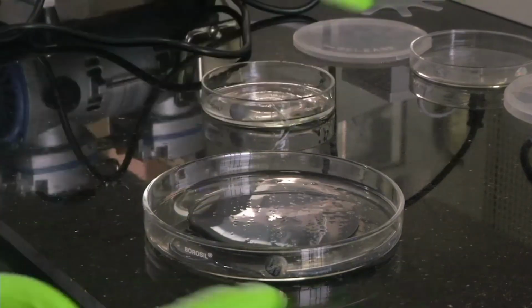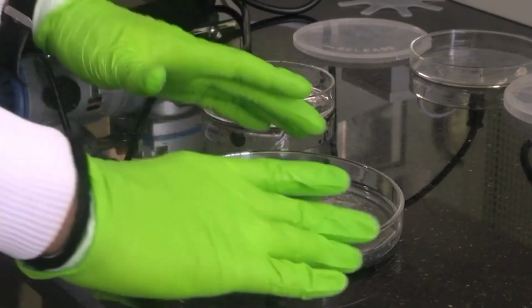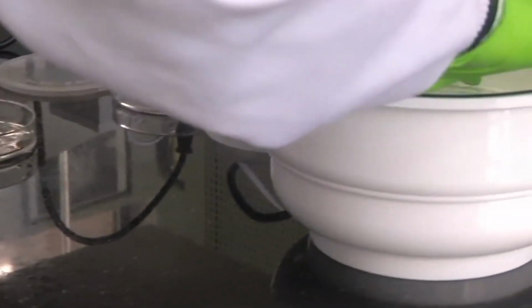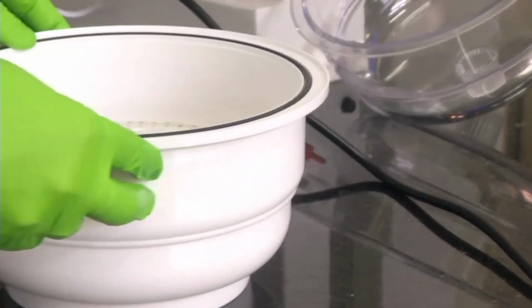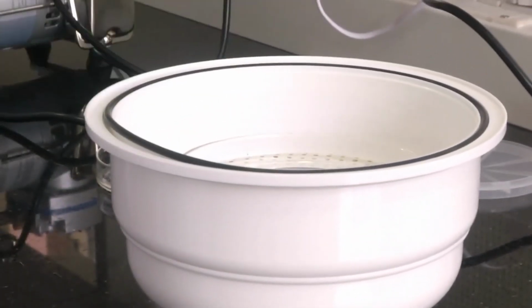Now we have to do the desiccation process again with the PDMS on the silicon mold, and then remove these air bubbles also. So this one I am taking, putting it again back inside the desiccator. I will put the desiccator back into view for you. Now we have put the PDMS and the silicon mold.